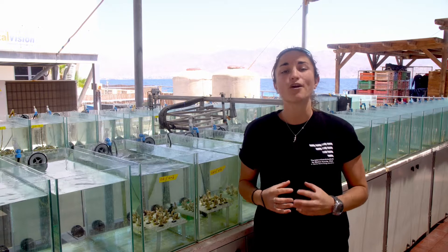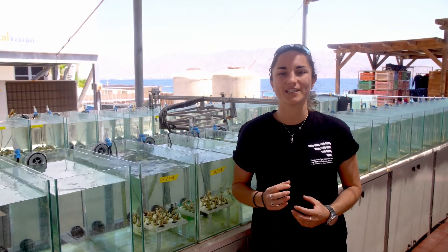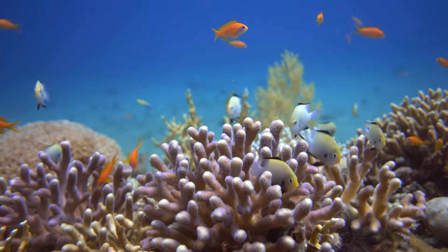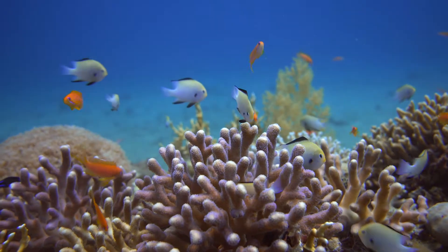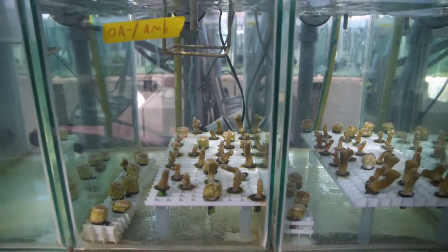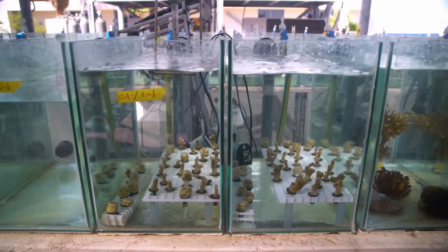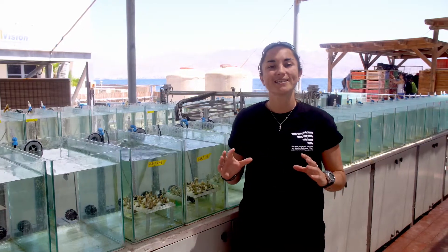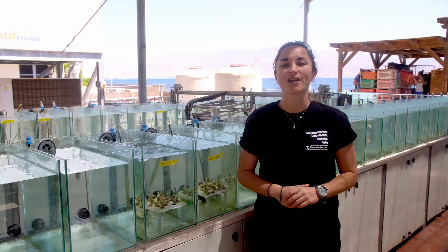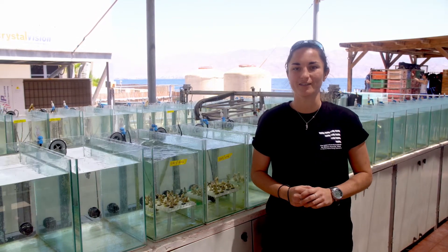We are now in a phase of rapid climate change and it is vital that we understand how these changes will affect our valuable coral reefs. However, simulating these conditions in the field is highly complex, and therefore scientists are advocating the use of mesocosm systems to conduct experiments. The Red Sea Simulator is a large-scale flow-through system which has the ability to run long-term experiments under simulated future ocean conditions.